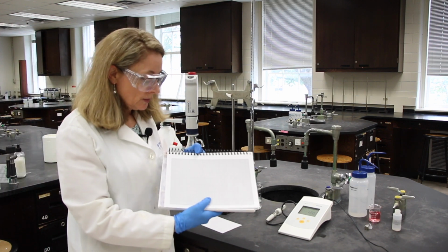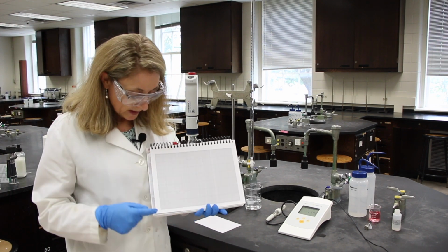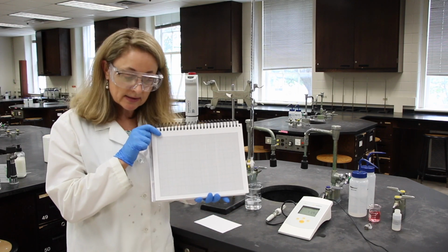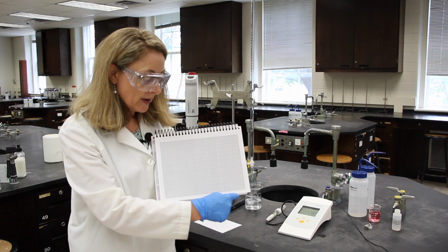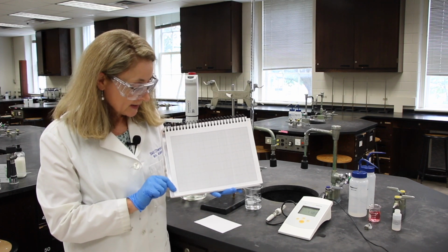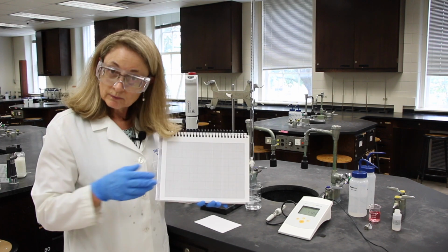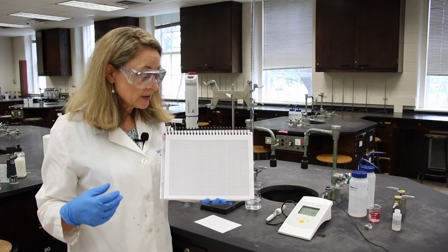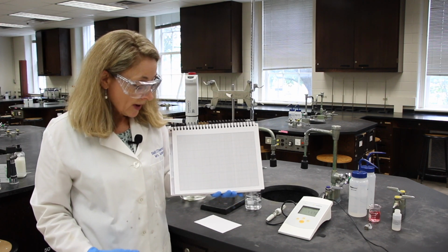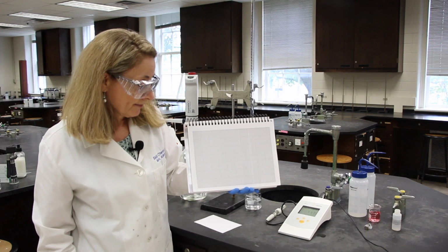When you have recorded everything, you need to make a graph. The pH should be on the y-axis, oriented landscape, and the milliliters of NaOH added should be on the x-axis. Give your graph a good title. Go to experiment 15 to look what a good title might look like, and graph your data in a smooth set of points.